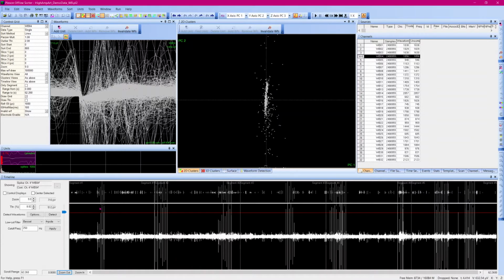It is easy to see the presence of artifact bouts in this file because they vastly exceed the amplitude of the signal. Looking at the data for a channel, it appears there may be an isolated cluster, suggesting a spike unit is present in this channel, but it is almost impossible to parse out because of the high amplitude waveforms contaminating the signal. Removing the artifact not only will make the sorting easier, but it will also reduce the inclusion of artifacts into the final spike unit. Before using the Remove Artifact tools, I need to know the characteristics of the artifact.